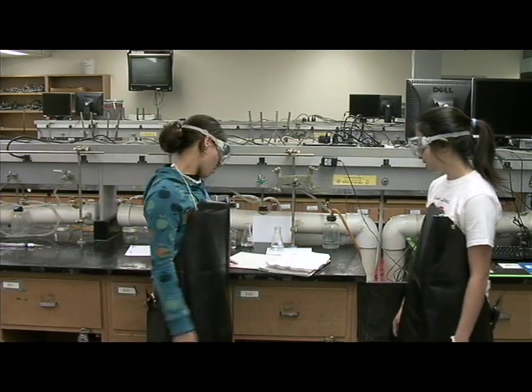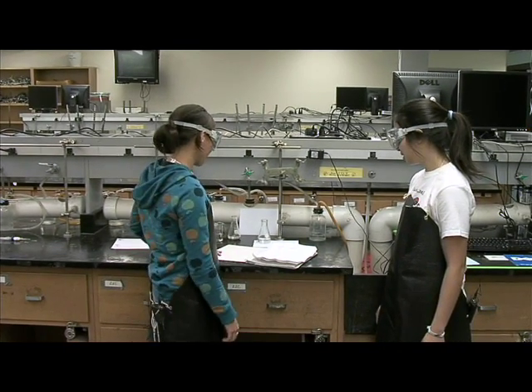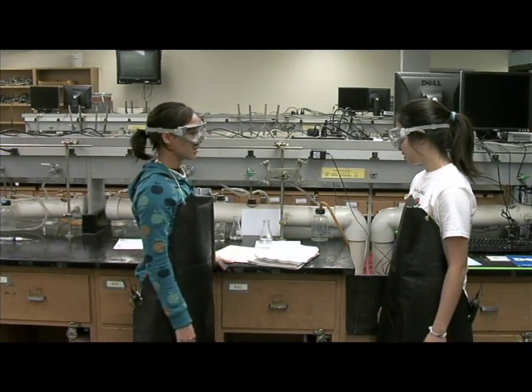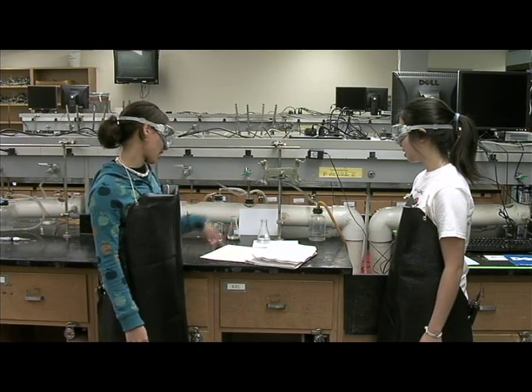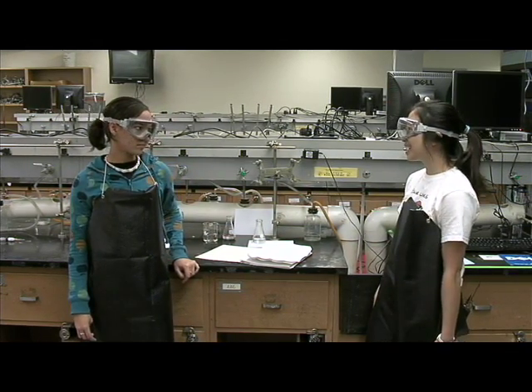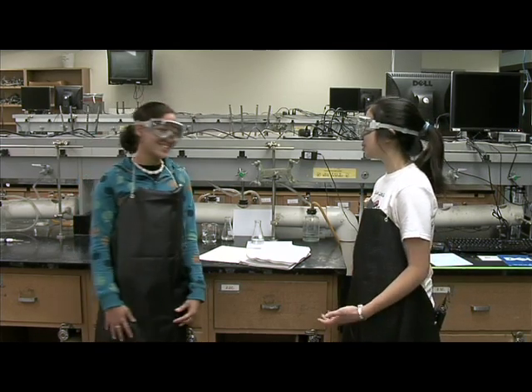About that. Okay, it says that we need a burette. Why don't you go get that? We already have the titrant and the analyte all here and the indicator. Okay, burette back! Get it? Be right back! Just go!